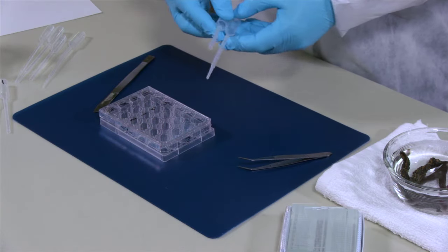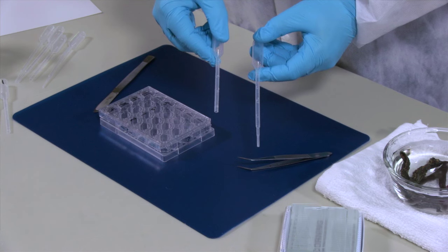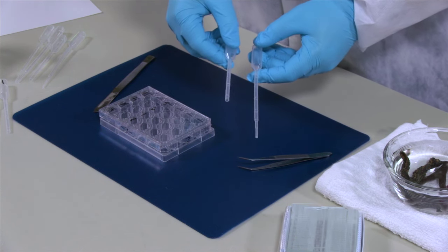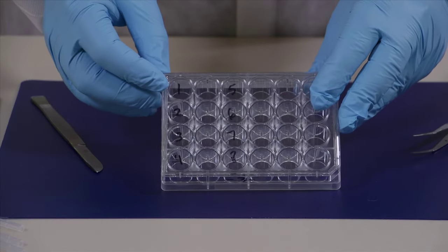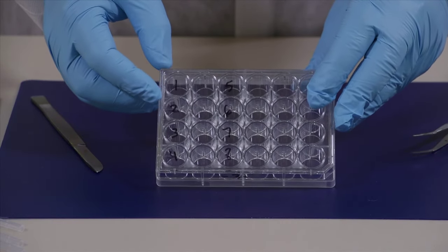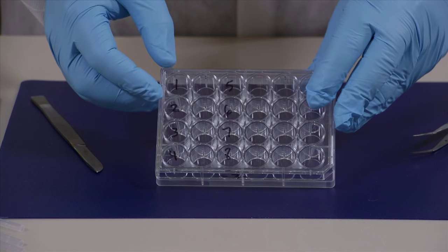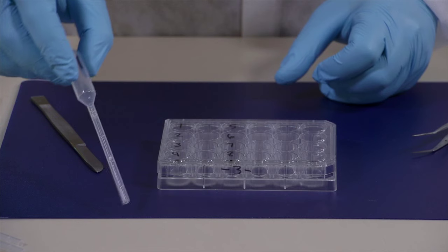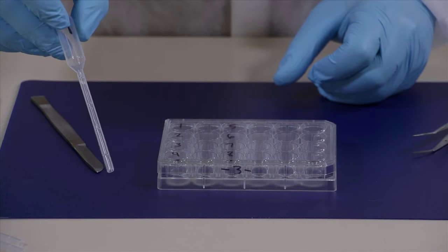I like using these pipettes where I cut the end off of one to make it a little bit shorter but it's also a wider end to the pipette in case you have some very large spicules. Make sure that you label the tray with some kind of number to identify each specimen. To avoid cross-contaminating each specimen it's a good idea to also label the pipette tips with each specimen.